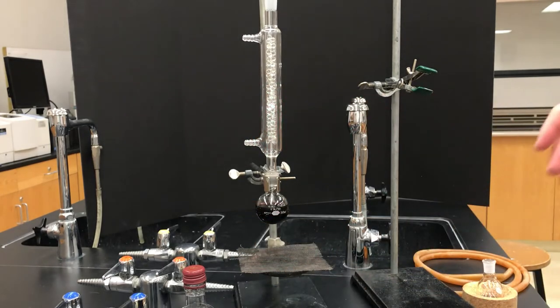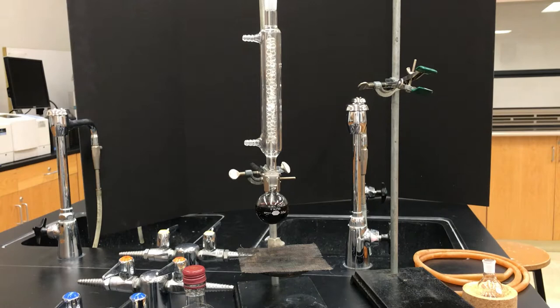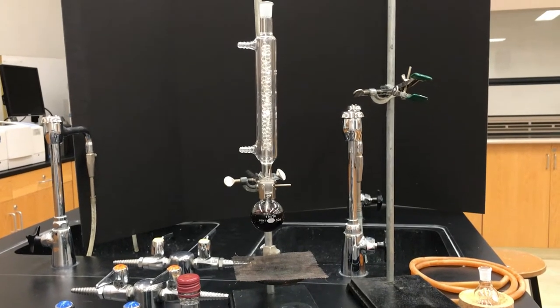These columns have little nubs where you could hook up hoses, but we actually don't want that. We want it open to the air.